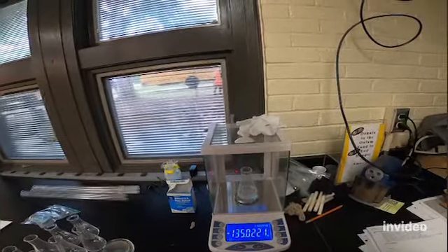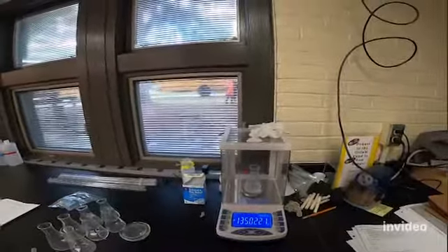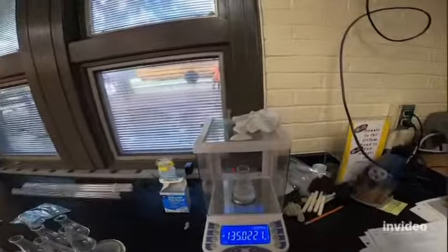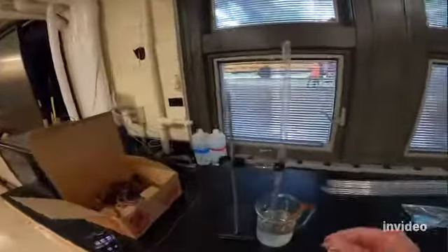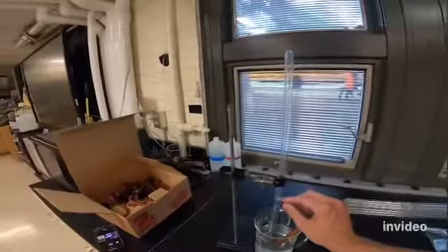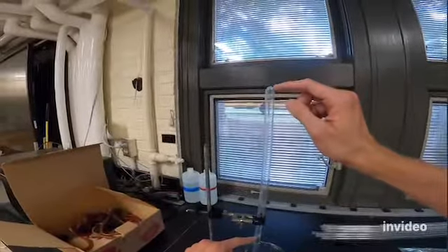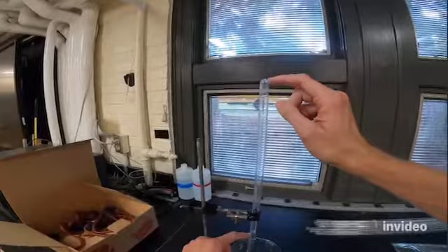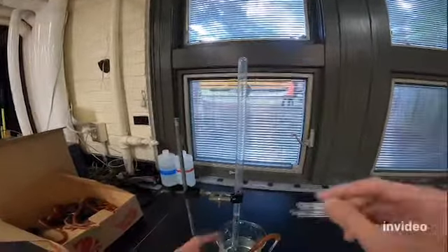And you should see a subtle change. And basically what the change that we're seeing is the gas that escaped. So it should be slightly lower. And if it is slightly lower, then that's good. And that tells us that's the mass of this bubble of air that's in here. So this is carbon dioxide that came out of the Alka-Seltzer tablet.